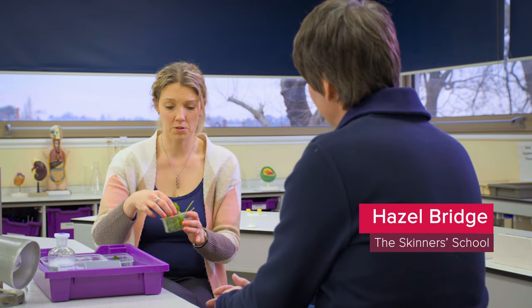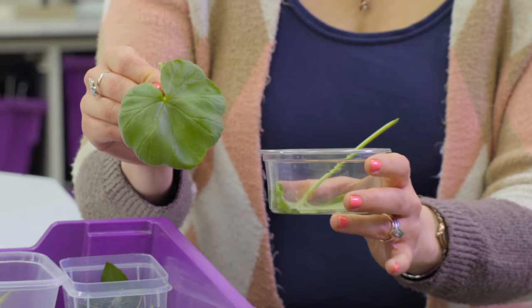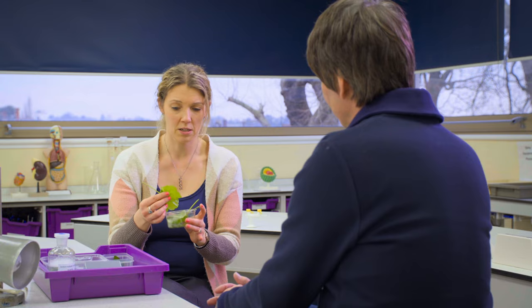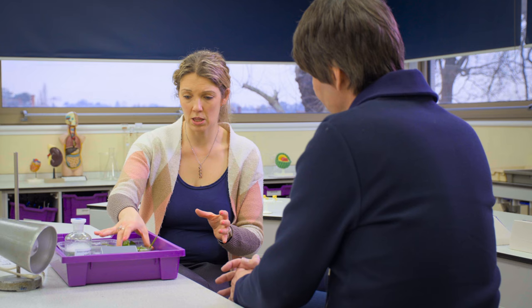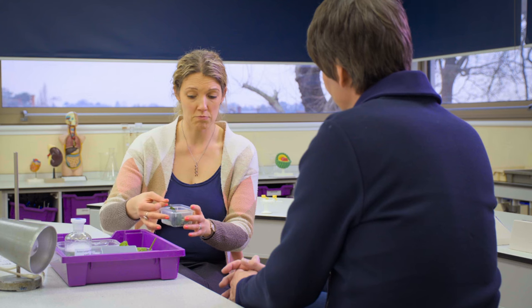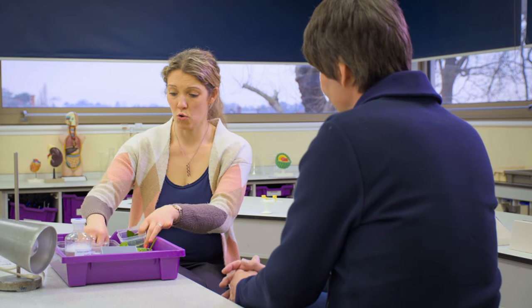You're going to need leaves. These are geranium plants - these like full sunlight - but you can use things like cress if you allow the leaves to grow big enough. For shade plants, there's something called a cast iron plant you can use, but we used ivy, which is very easy to get a hold of, or laurel.